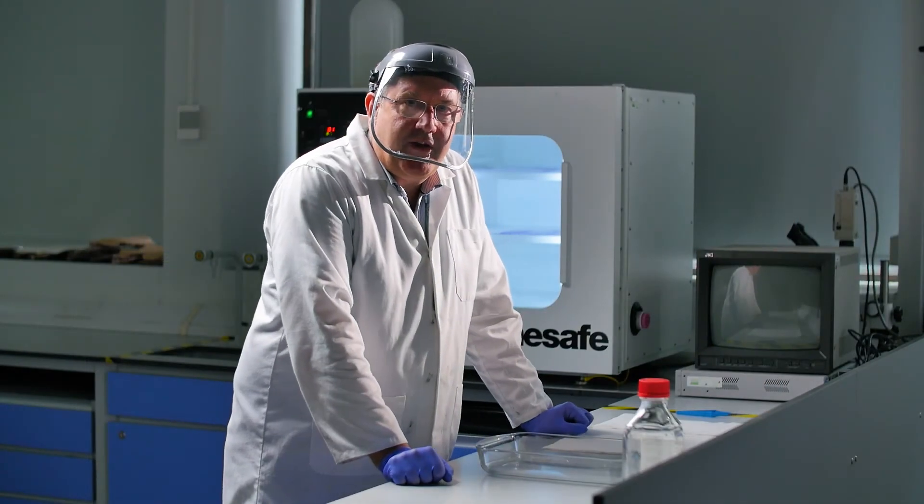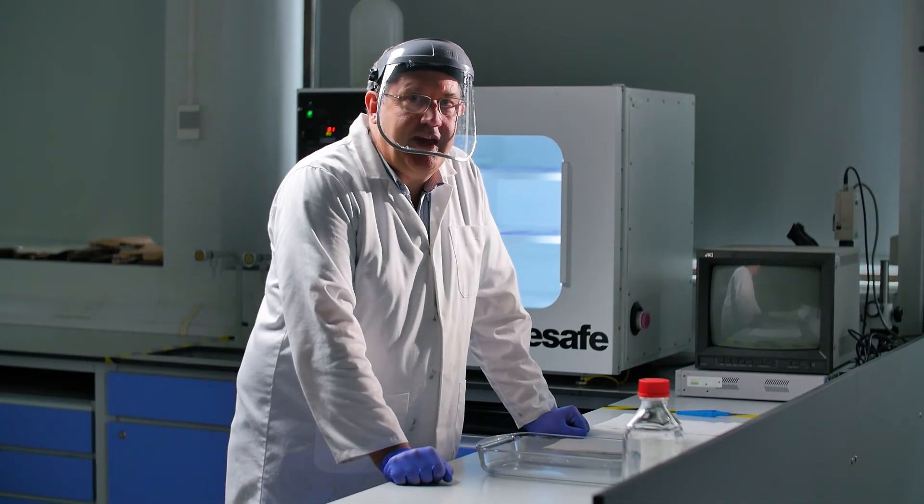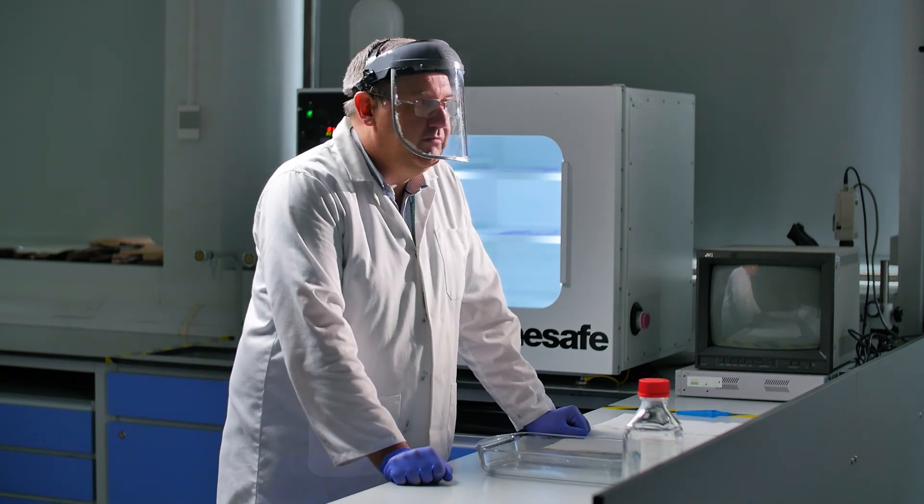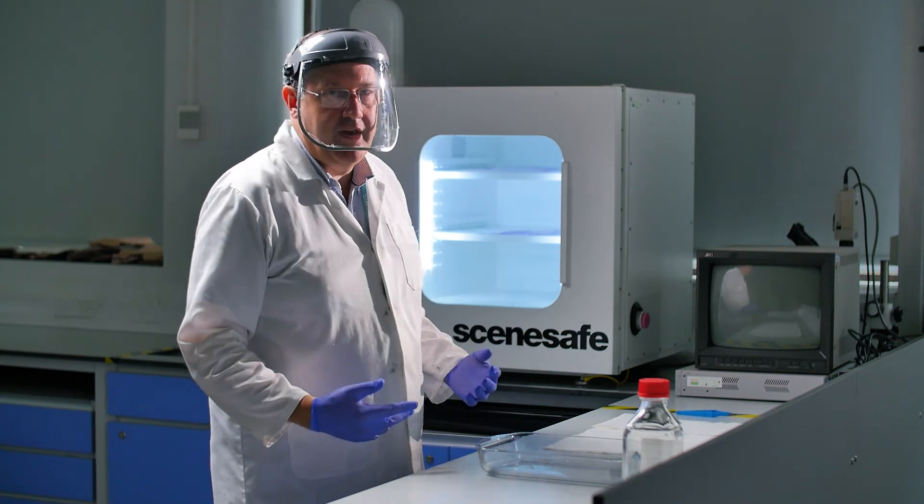Okay, so I think the four minutes is about up now. What I'm going to do is open that cabinet and bring the paper samples out and have a look at whether we've got anything. And actually from here I can see we've got a lot of fingerprints on there.